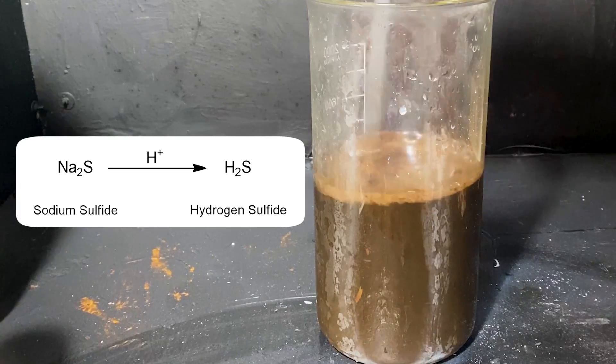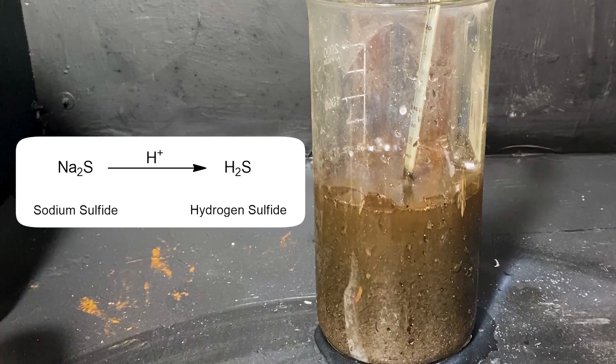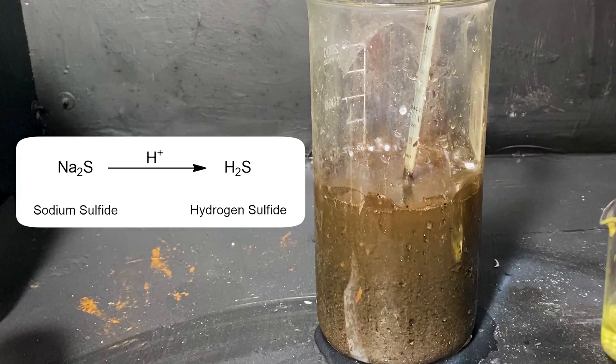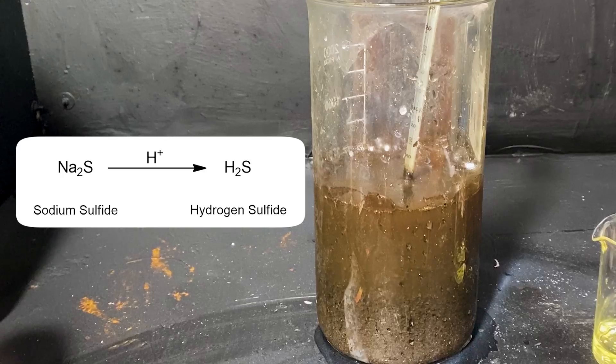If I were to use the sodium sulfide with the acid present, then it would get hydrolyzed into hydrogen sulfide, which is a gas that is more toxic than hydrogen cyanide. And trust me when I say this, it smells like shit and gives you a headache if you inhale trace amounts of it.